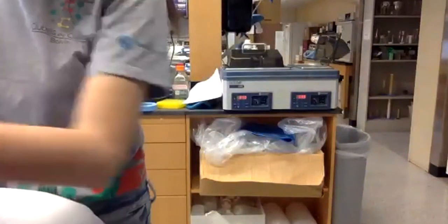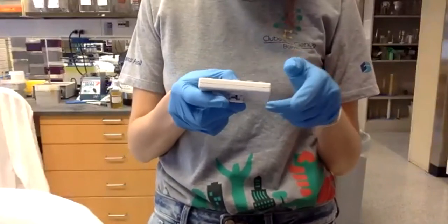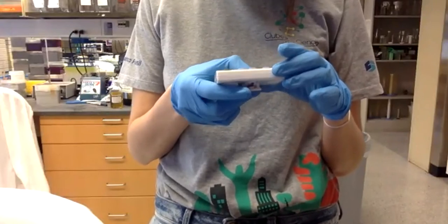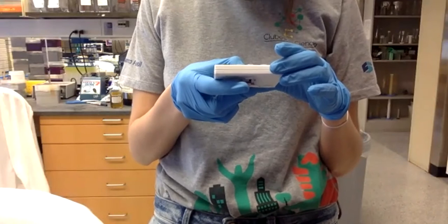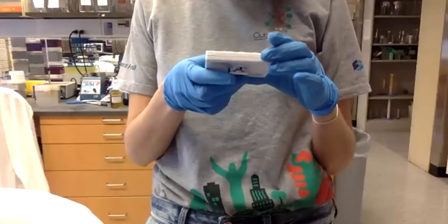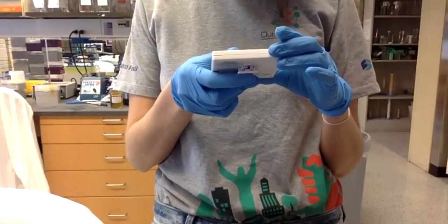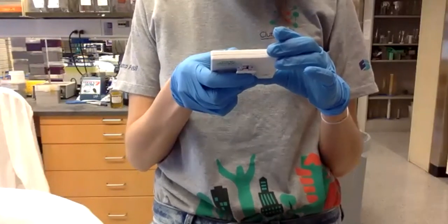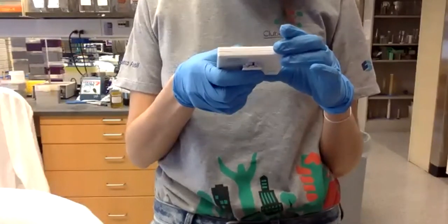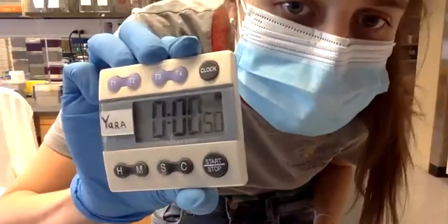So I will put the timer for exactly 50 seconds.